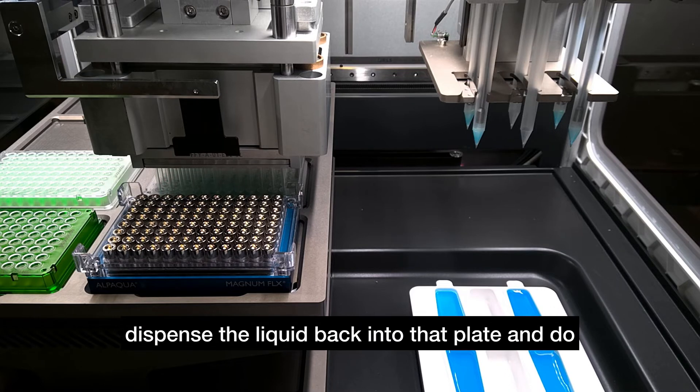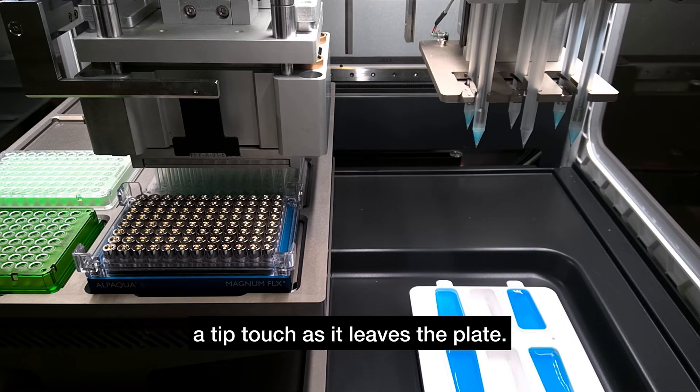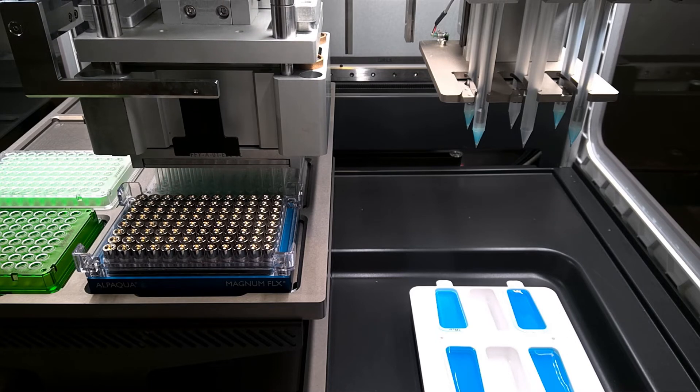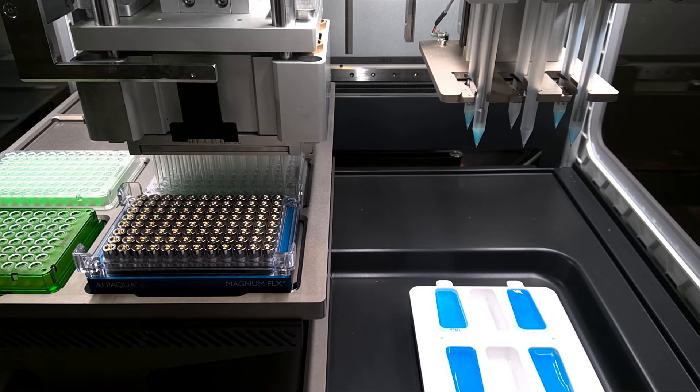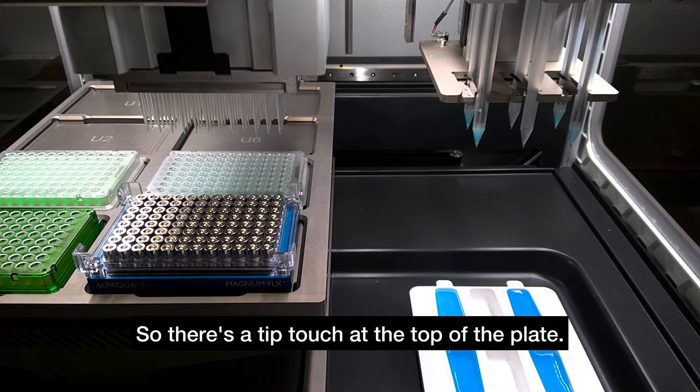And at the end of that, it's going to dispense the liquid back into that plate and do a tip touch as it leaves the plate. So there's the tip touch at the top of the plate.